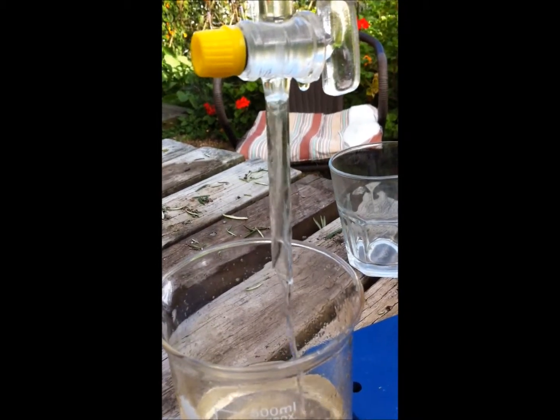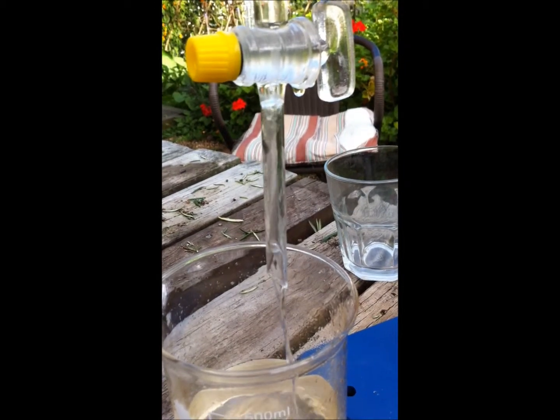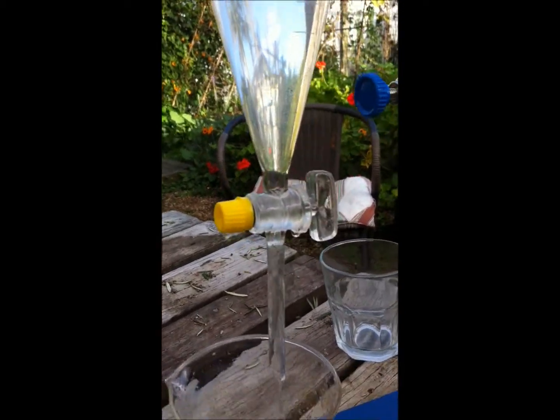I can still see there are a lot of tiny minuscule bubbles of oil — I probably didn't leave it long enough to settle, so I might run it through twice.